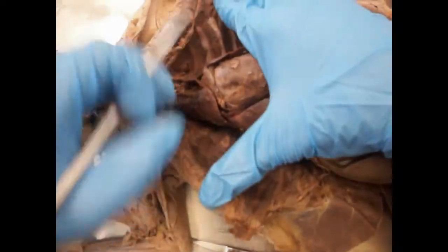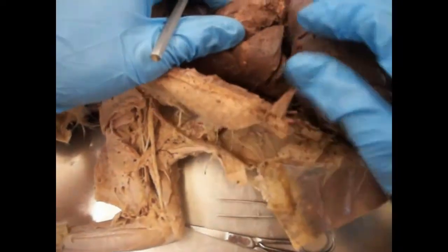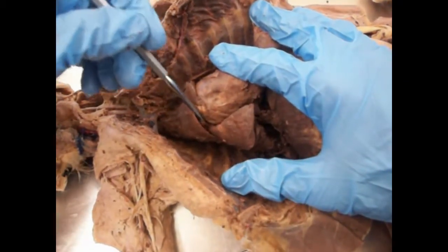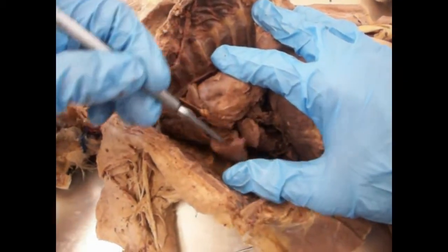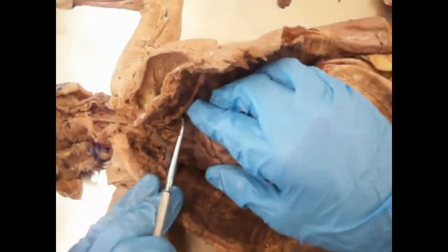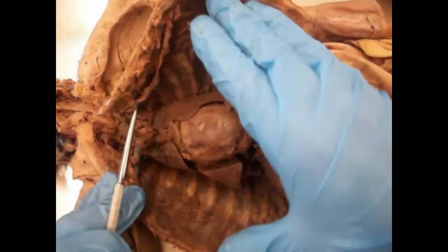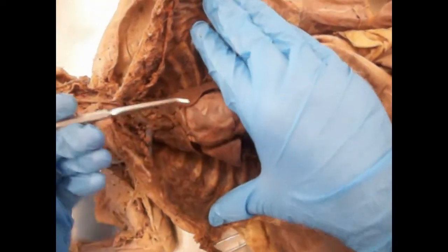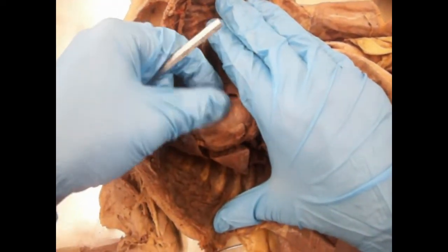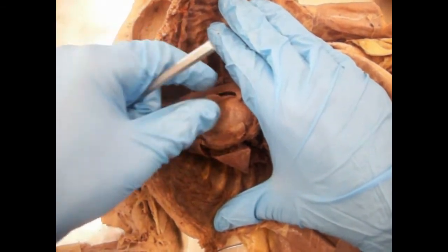Now moving on to the right side. That lobe, the first one that you're going to see, is called the right apical. Right under the right apical is the right cardiac, and right below that, closest to the diaphragm, is the right diaphragmatic. Now the interesting thing about the heart is that it does have a covering, and that covering is called the pericardium. The pericardium prevents friction rub.